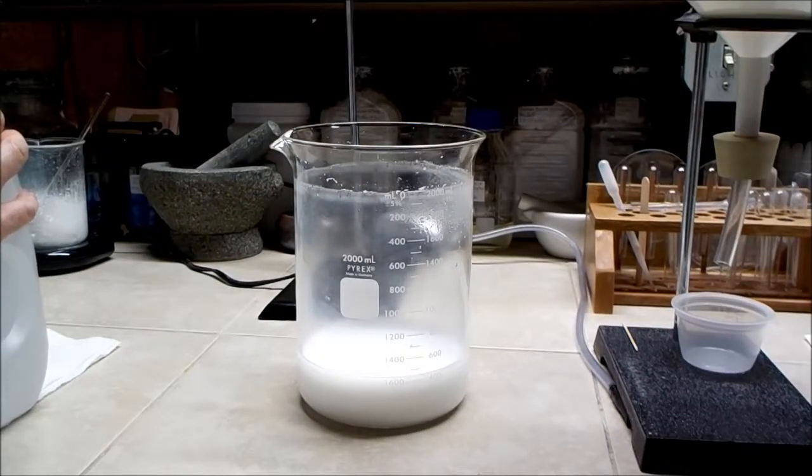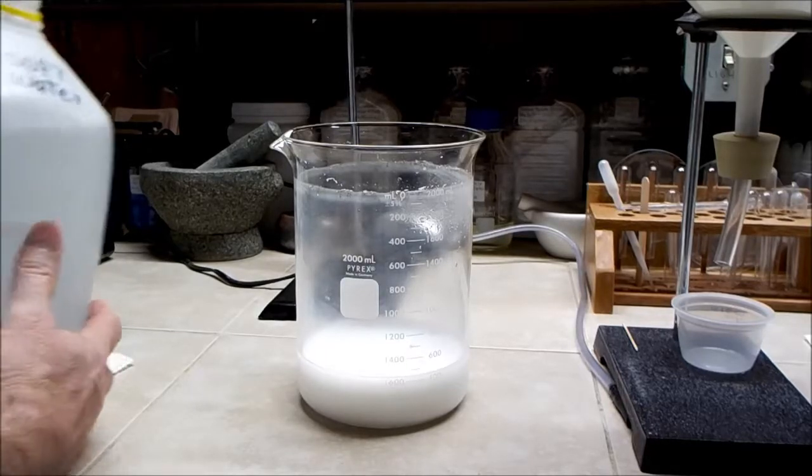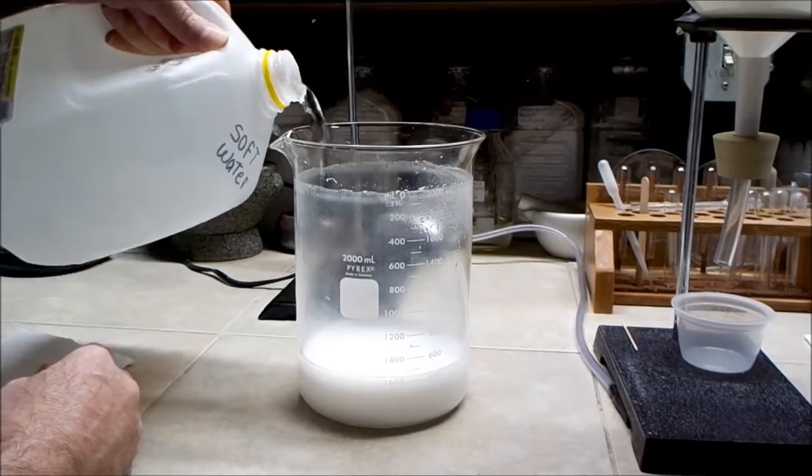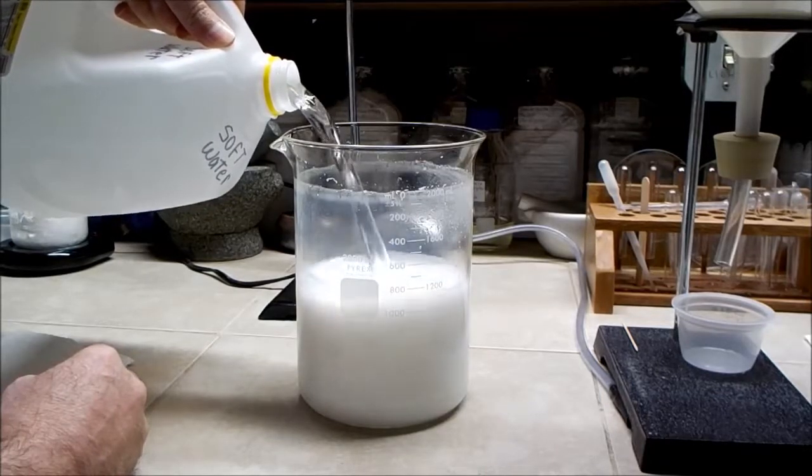Okay, so I think I'll wash it one more time just to get as much salt out as possible. It should be pretty good after this. I'll probably just let this set overnight since it's getting late.